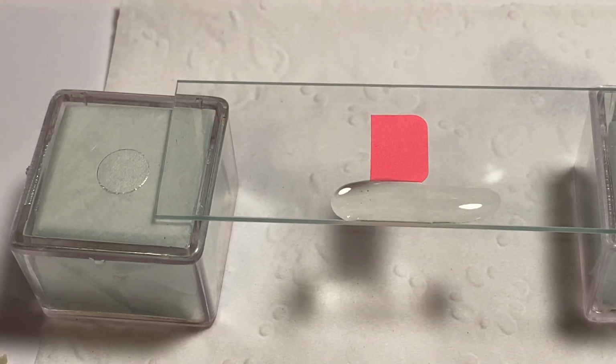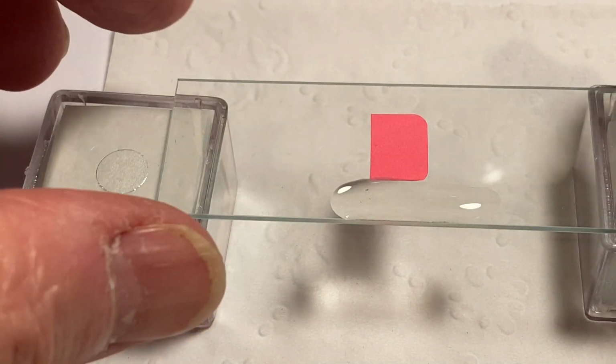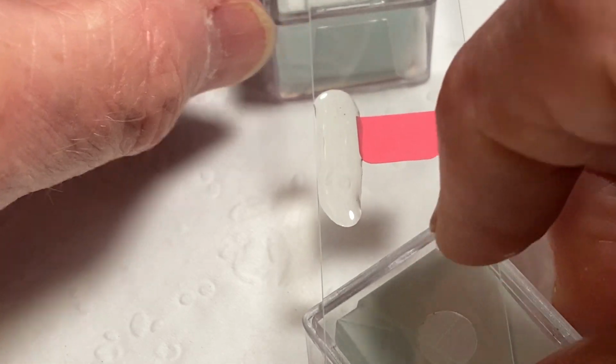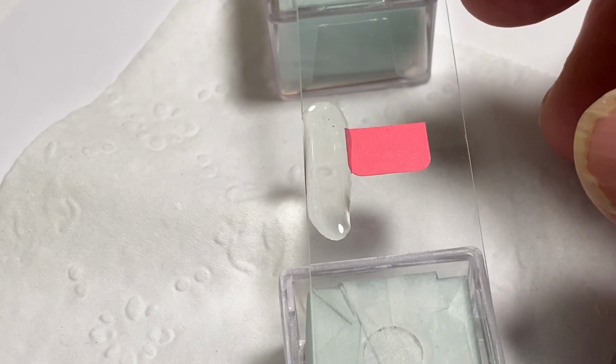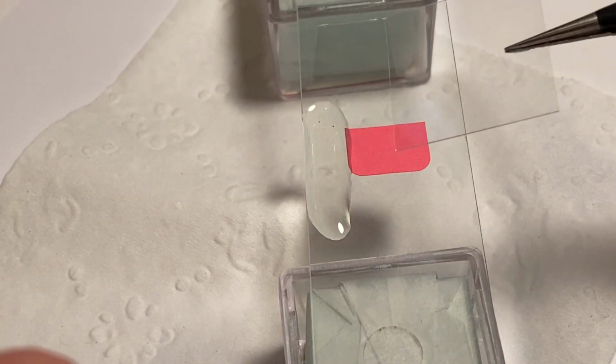And then I will put the cap back on the permount because I don't want that even to dry out. Okay, and then we are going to add the cover slip, which is tricky. The cover slip is very tricky. This is where you introduce your bubbles. And even if you're as careful as can be, sometimes you still get bubbles.